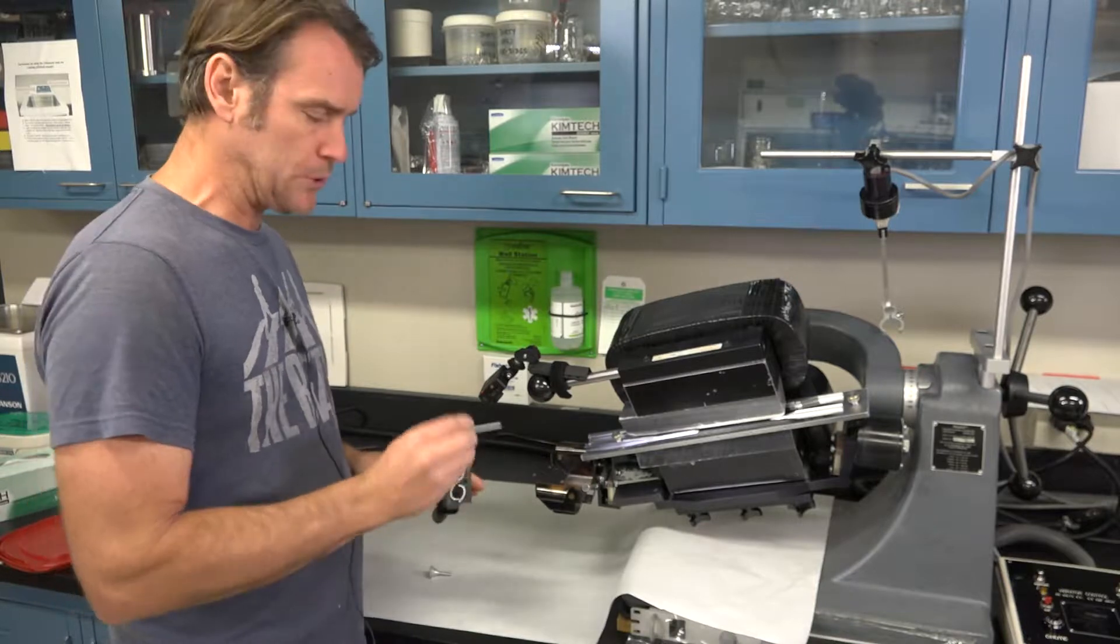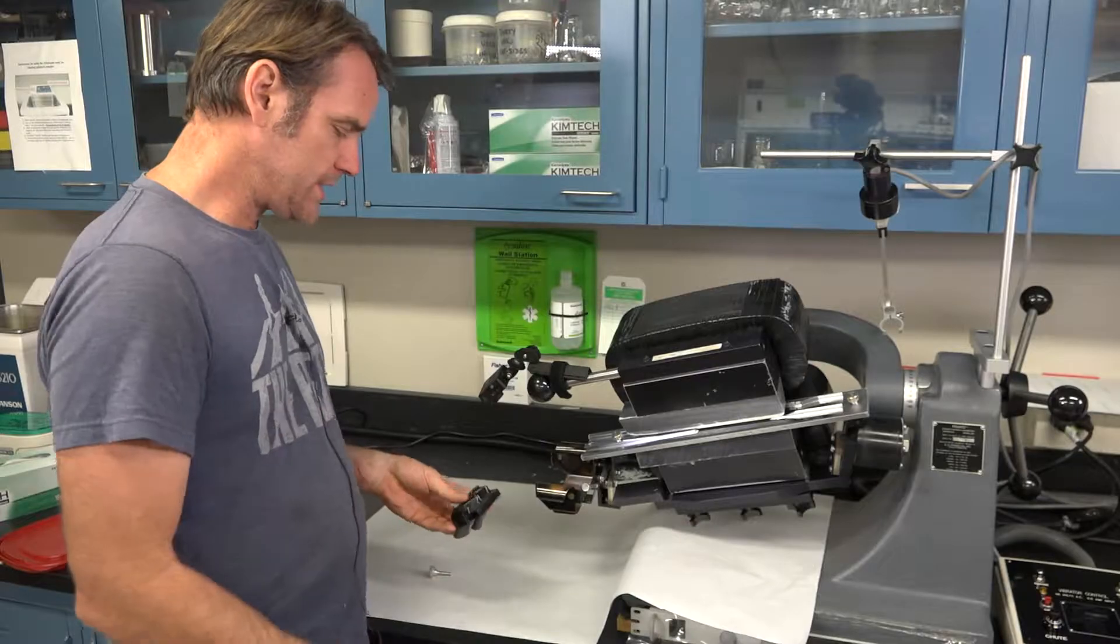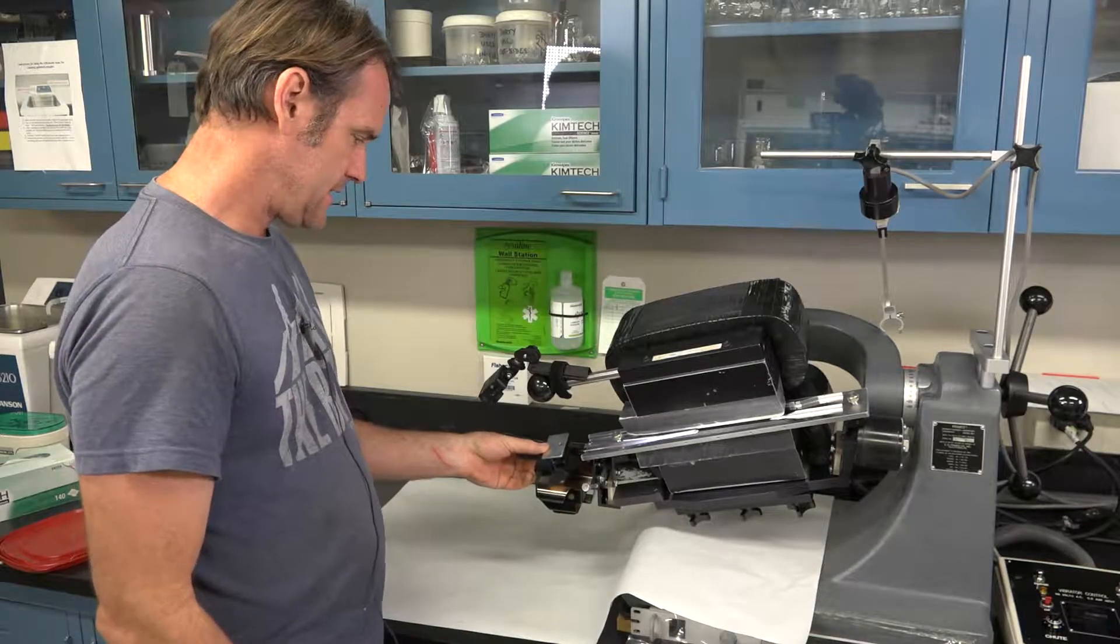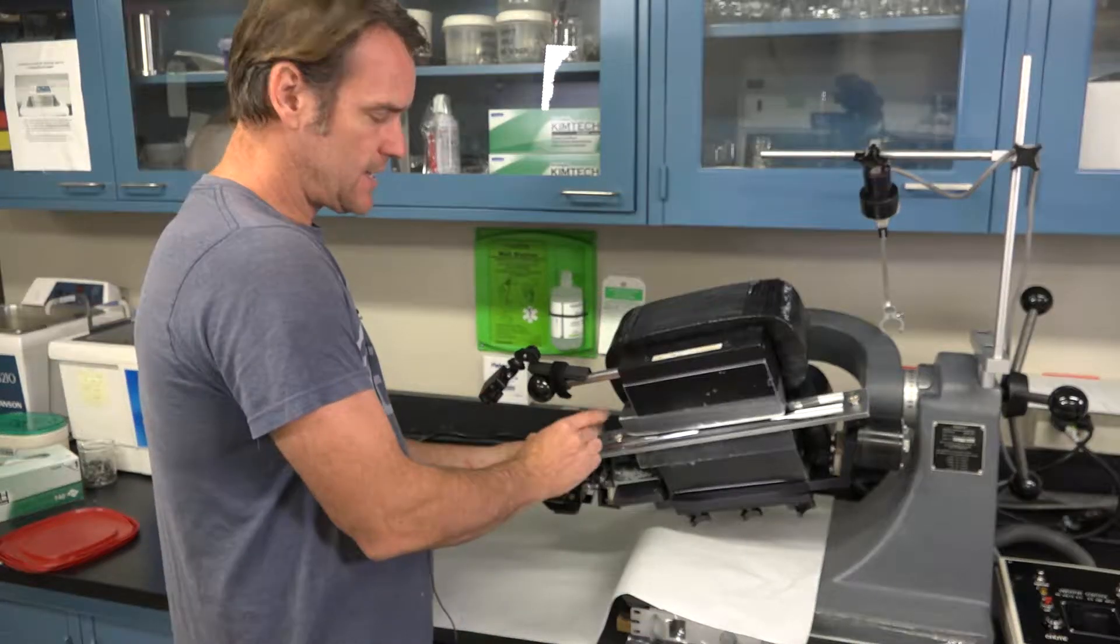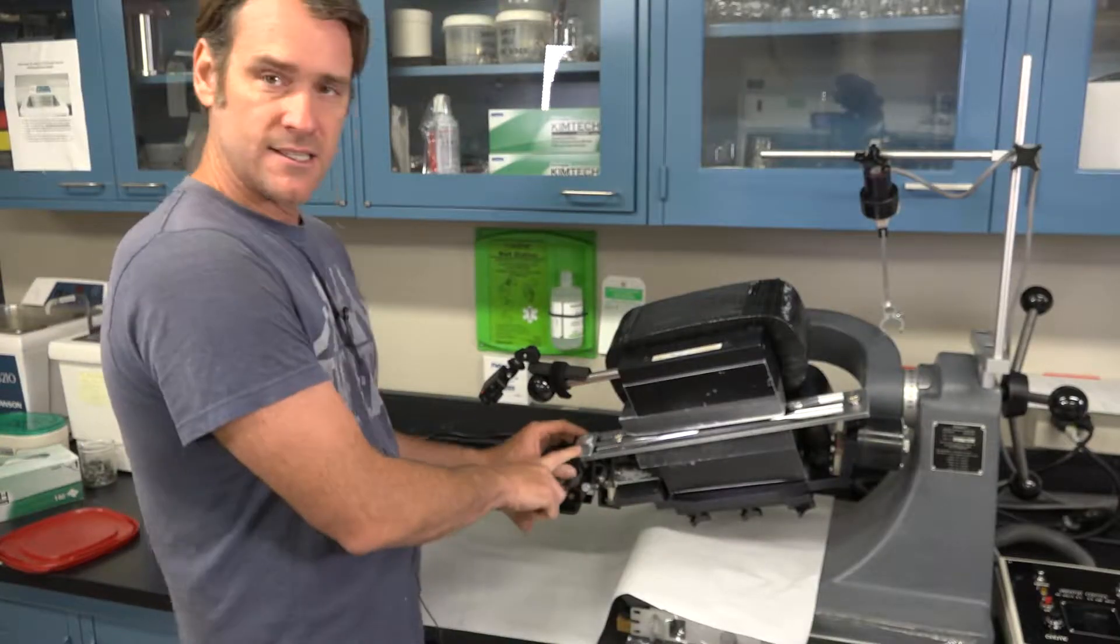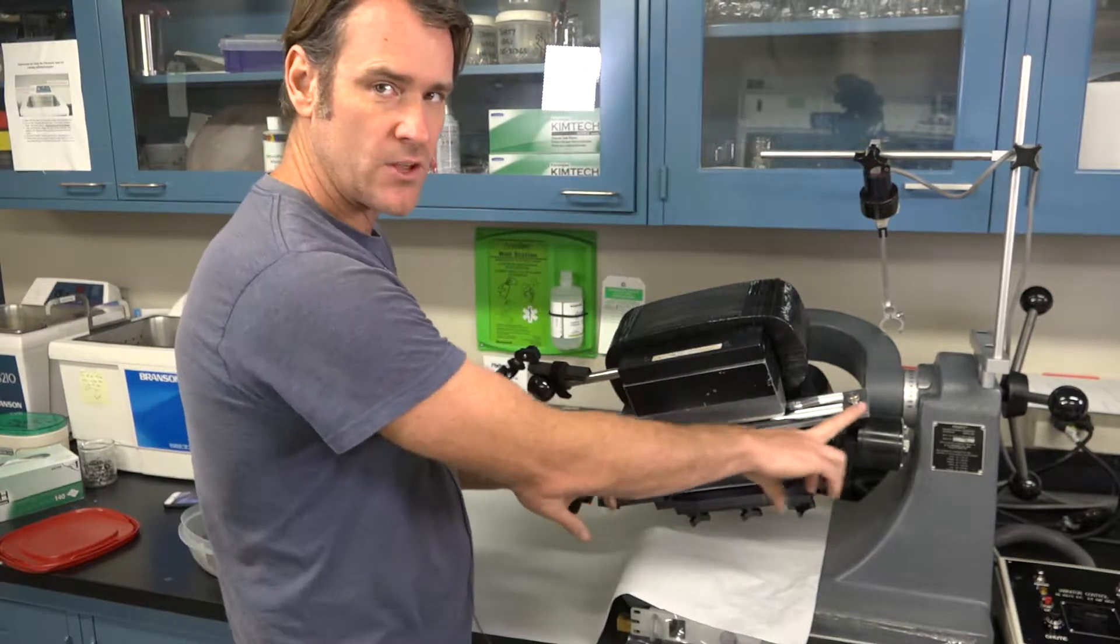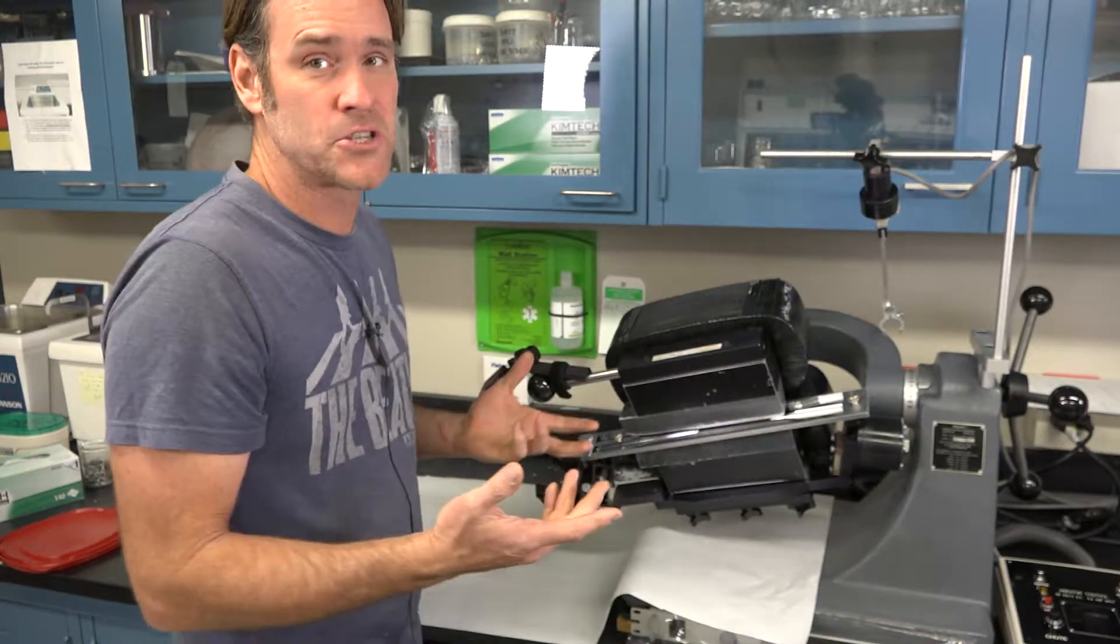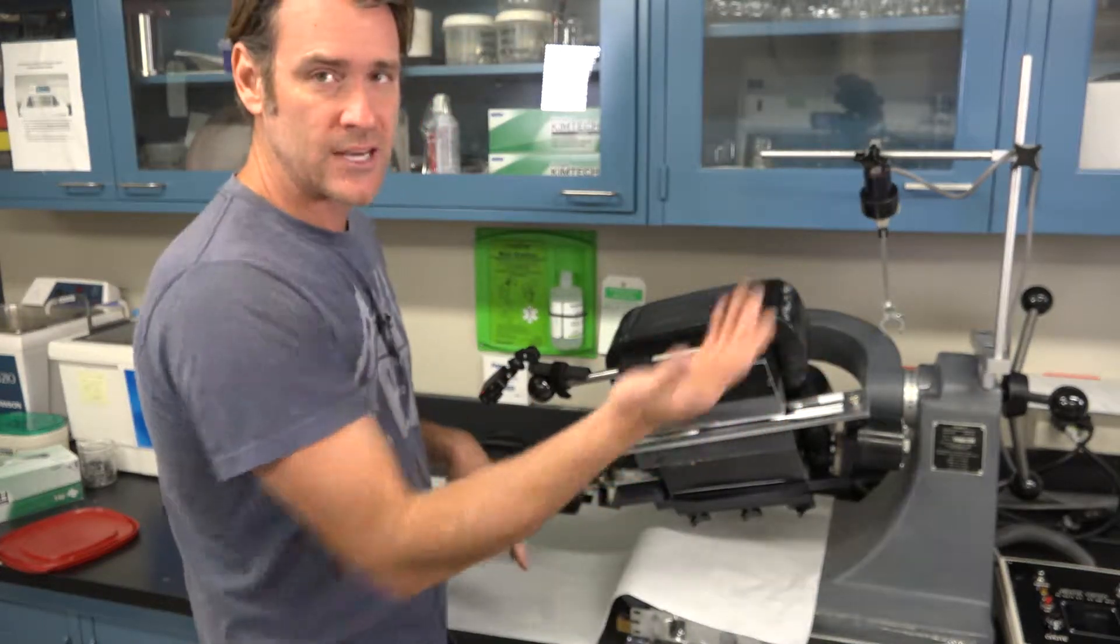For our lab we have so much throughput that I made an aluminum shield that goes on top. The way you hold this is you hold your chute, hold the shield on top of that, and then you can slide it onto the ramp and the bolt goes through. This is an aluminum bolt. Make sure you don't over tighten this because it's a plastic chute thread, whereas up here the original chute you want to make sure pretty tight because that's going to be vibrating sometimes for hours, almost all day long. If one of these comes loose, that chute can actually slide around.